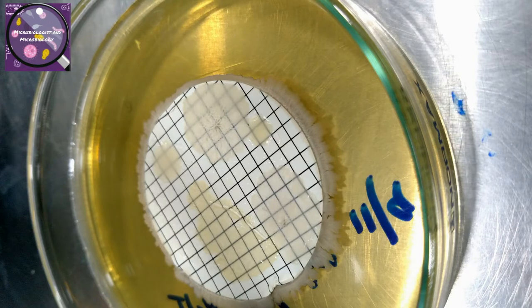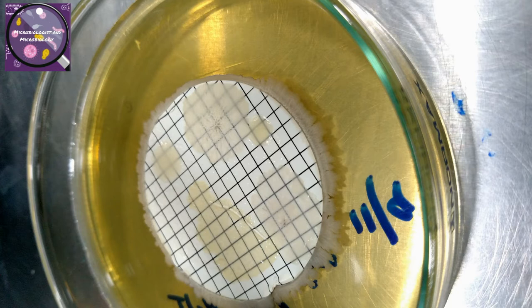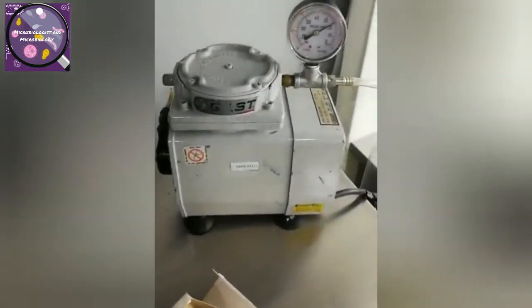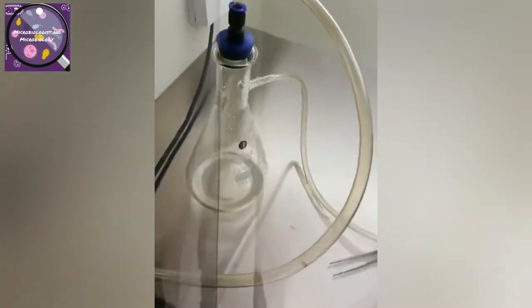Membrane filter technique is an effective, accepted technique for testing fluid samples for microbiological contamination. It involves less preparation than many traditional methods and is one of a few methods that will allow the isolation and enumeration of microorganisms. Membrane filters are used extensively in the laboratory and in industry to sterilize fluid materials.